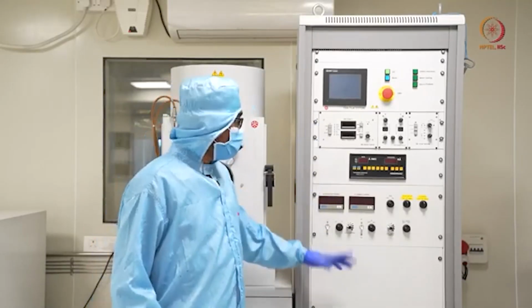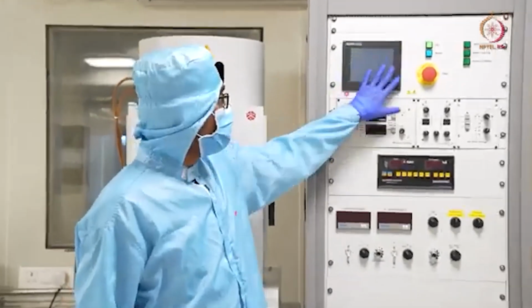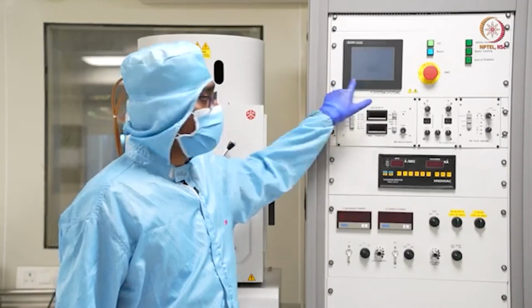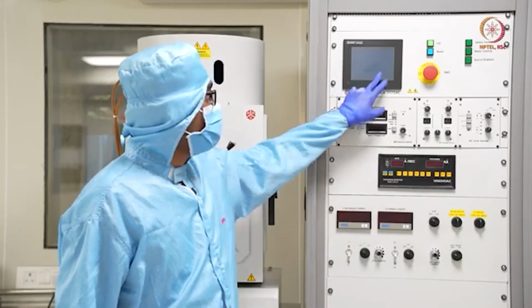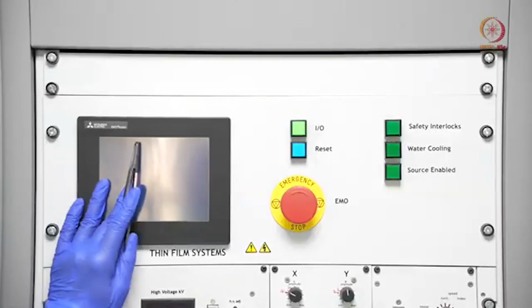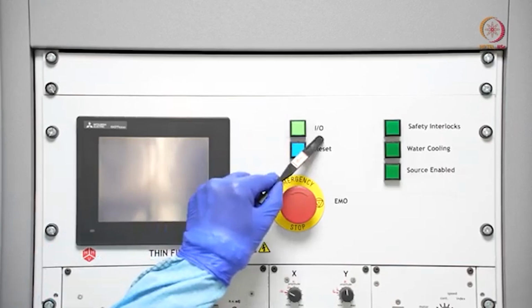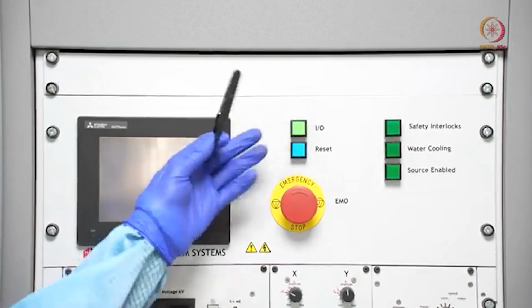After that part we will come to the controller part. These are the units that will basically be controlled by this area, and this is the display. So let us start from the top. This is the display where the system status will be shown, and it is basically a touchpad based system. On this touchpad display we can select all the operations we want this tool to perform. After this display, let us come to this part. Here you can see 1 0, this is basically on off. This is a press switch, you can press it, it will be on, and if you press it again it will be off.